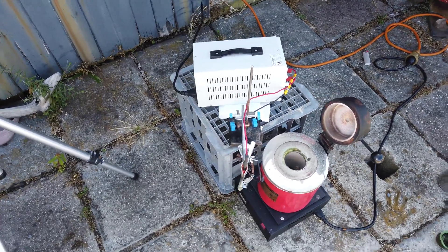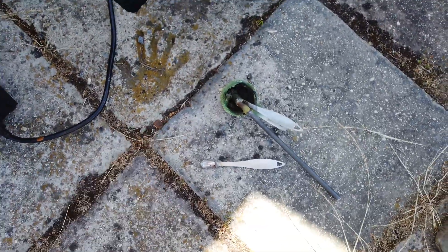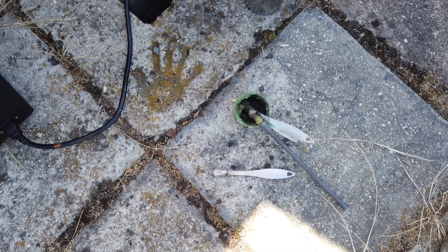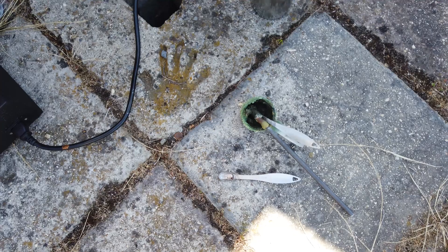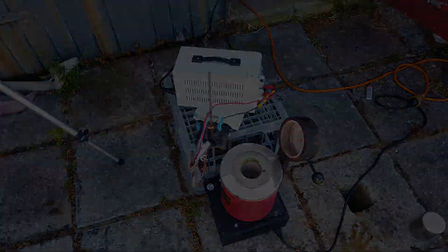We will come back to it one day and figure things out. I don't know why I insist on using stainless steel as a crucible for these experiments — it's probably a really bad choice. No potassium for us. I think it was kind of frustrating to see the potassium floating there and not being able to collect it, but I'm still pretty happy that we came this close. We were able to see potassium metal, which is better than nothing. I will be trying to make potassium metal again at some stage by electrolysis.